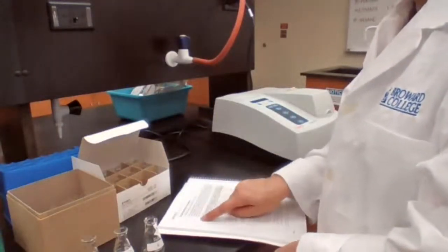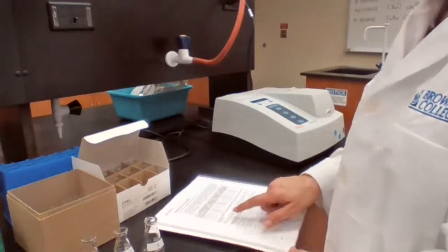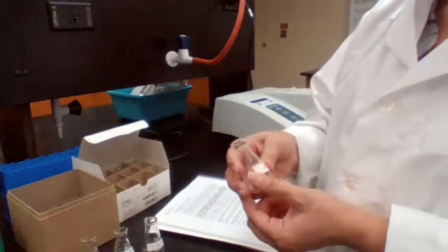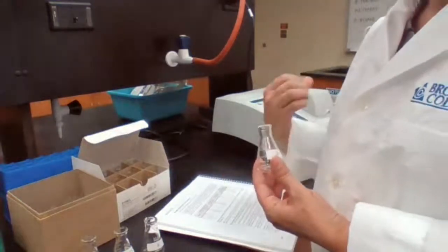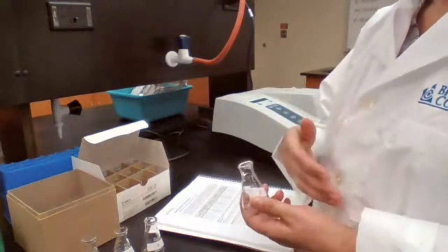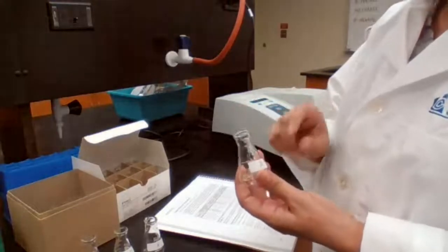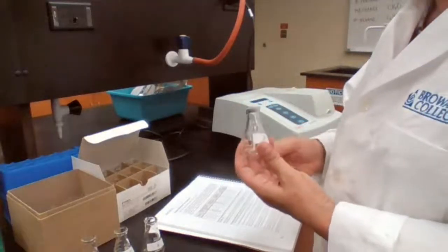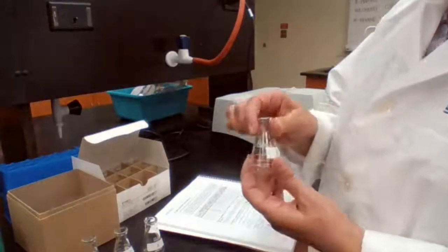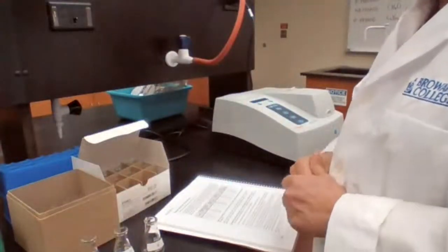So we are going to use the burette for each one of them, following the table, to flask A. Flask A is going to serve as a blank. Why are we using a blank? Because for better use of the instrument, we want to make sure that we have a reference to refer to as the zero absorption, because this is not going to have the active ingredient, so it's not going to have basically iron 3+. So whatever the measurement for this is going to be zero absorption. Ideally, the machine needs to be calibrated for zero absorption.